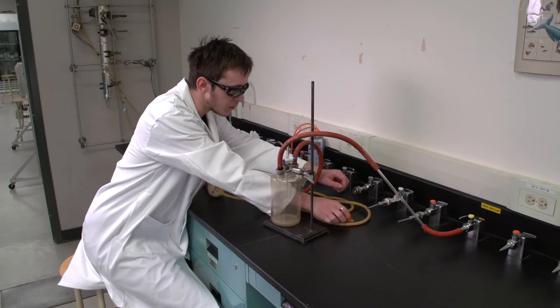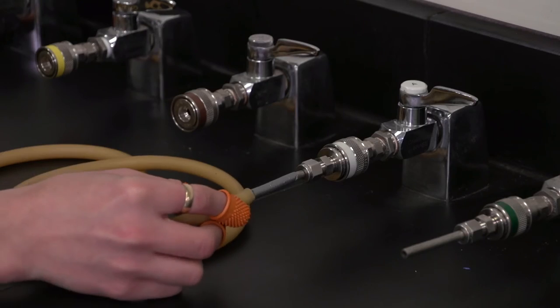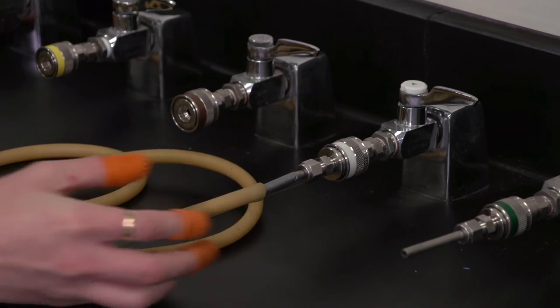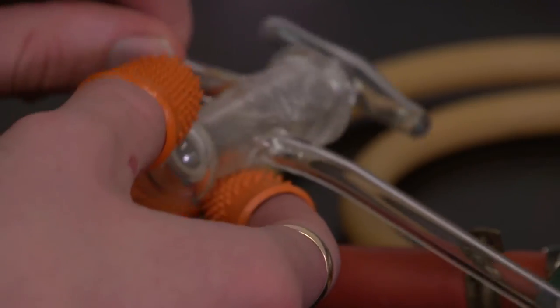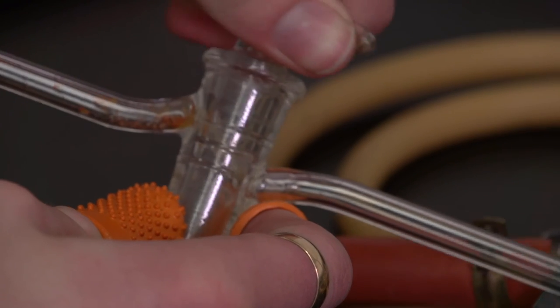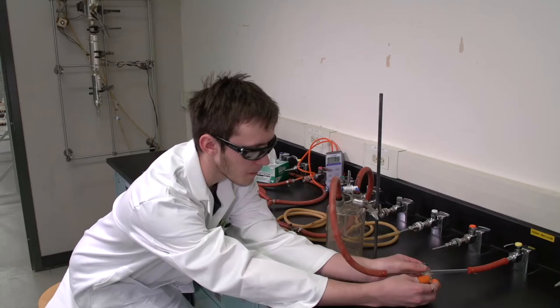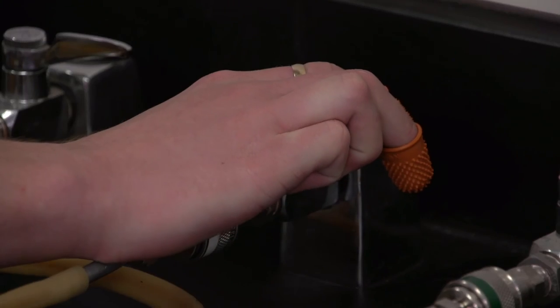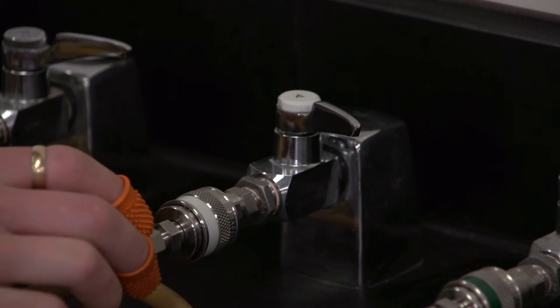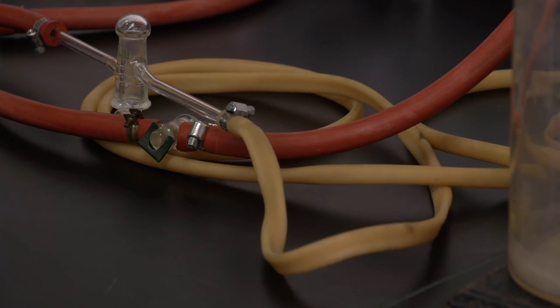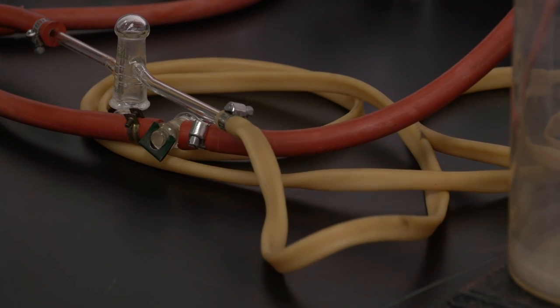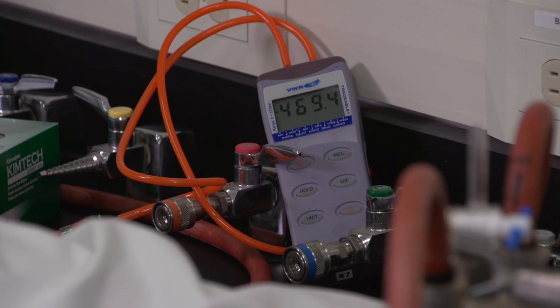To fill the system with argon or natural gas, connect the fill tube to the gas tap. Evacuate the system. Fill the system with gas to approximately 50 millimeters of mercury below atmospheric pressure. Repeat the process of evacuating and filling with a gas a total of three times to remove all traces of previous gases.